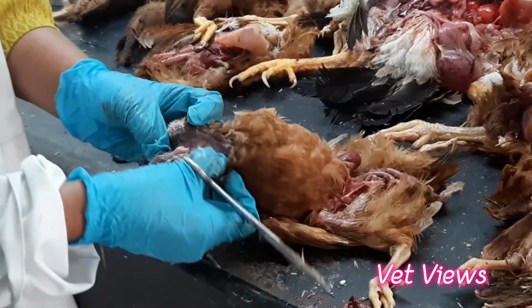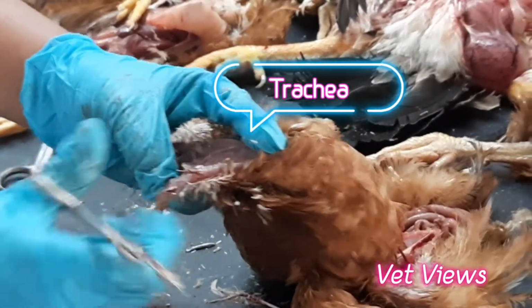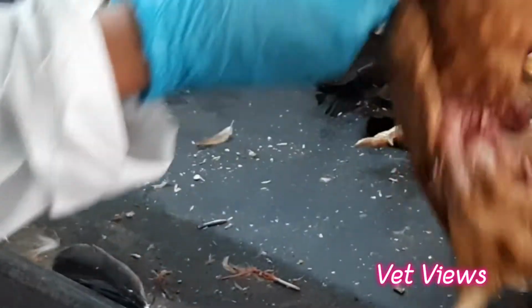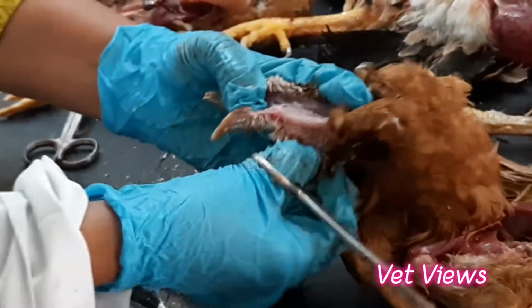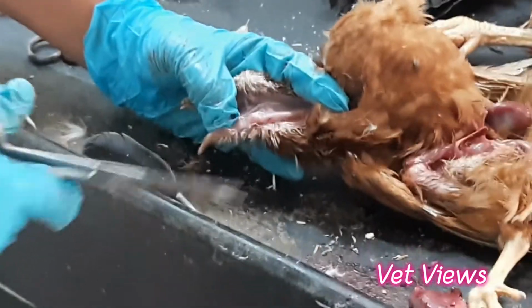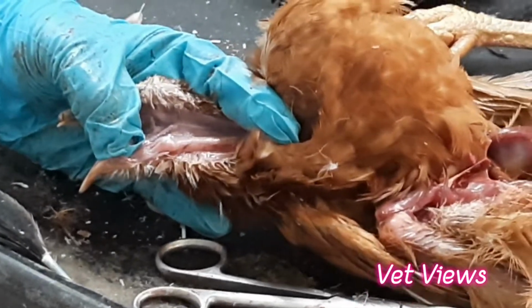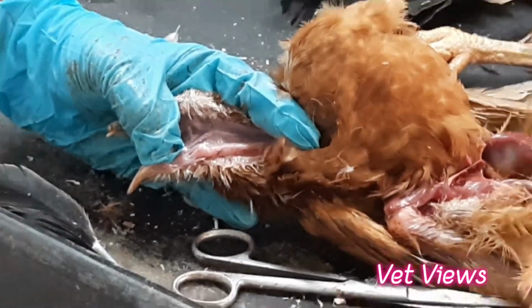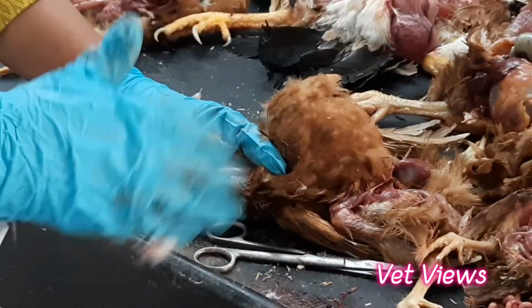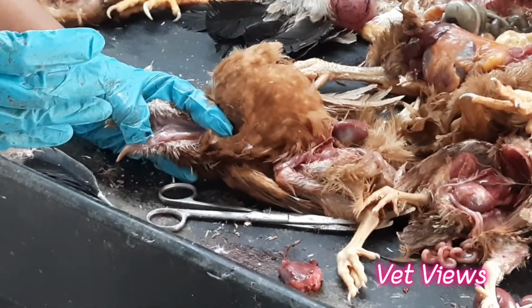This is the trachea. This opening is there, no? So this is the trachea. In respiratory diseases like ILT, infectious laryngotracheitis, the upper respiratory tract is severely affected. In a live flock, if you see, there will be severe bleeding from the mouth, and also in the feathers. Because the bird shakes its head, the blood clots will be on the body surface also. From that you can get a clue that these birds may have ILT infection.